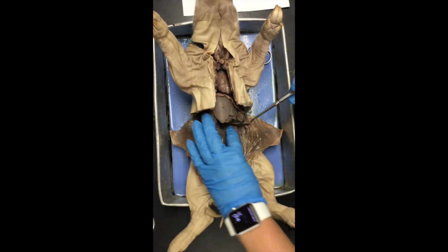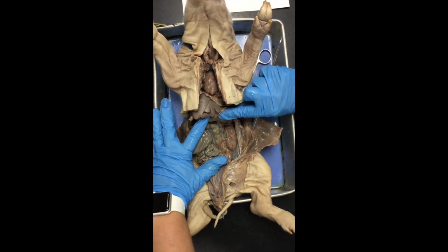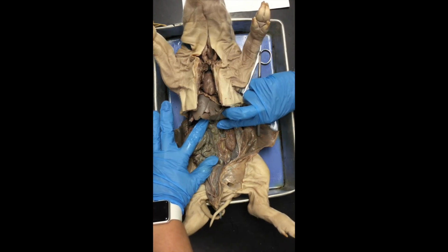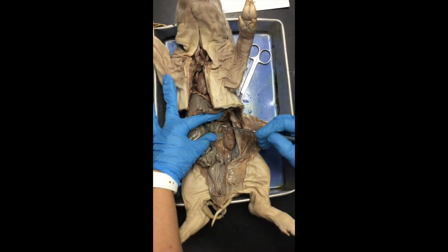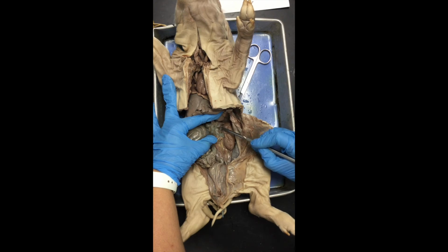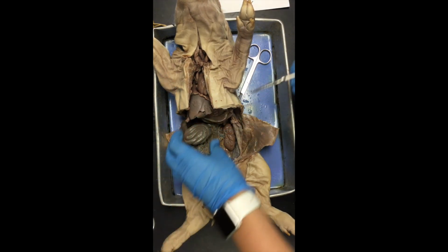Over here is the left adrenal gland, and to see it, you kind of have to push these abdominal organs out of the way. So I'm going to push the stomach and the spleen upward and roll the intestines over to the medial side. And if you look, there is this lighter color, like a light gray half moon structure. This is the adrenal gland. This would be the left adrenal gland because it sits just above that left kidney. There's another one on the right side.